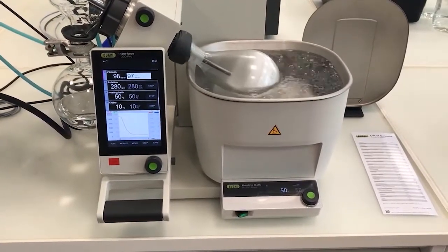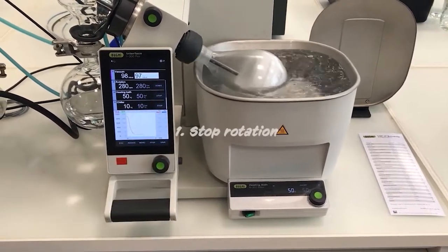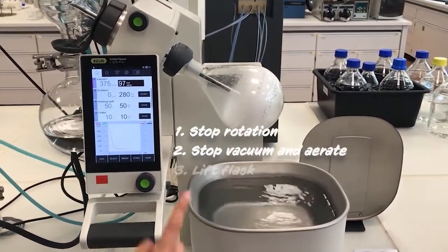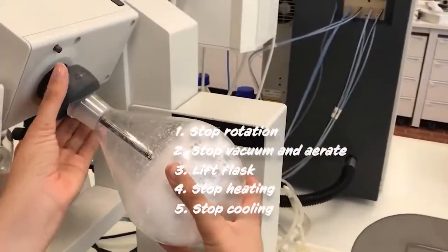Now that our evaporation is over, we need to stop the system. We firstly stop the rotation speed and then the vacuum and aerate the system until it reaches atmospheric pressure. We then lift up the flask and stop the heating and the cooling. I can now detach my flask.